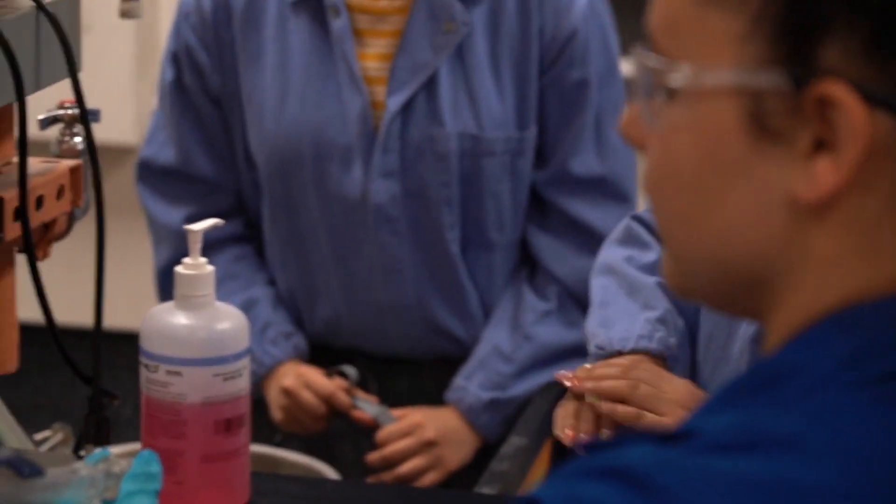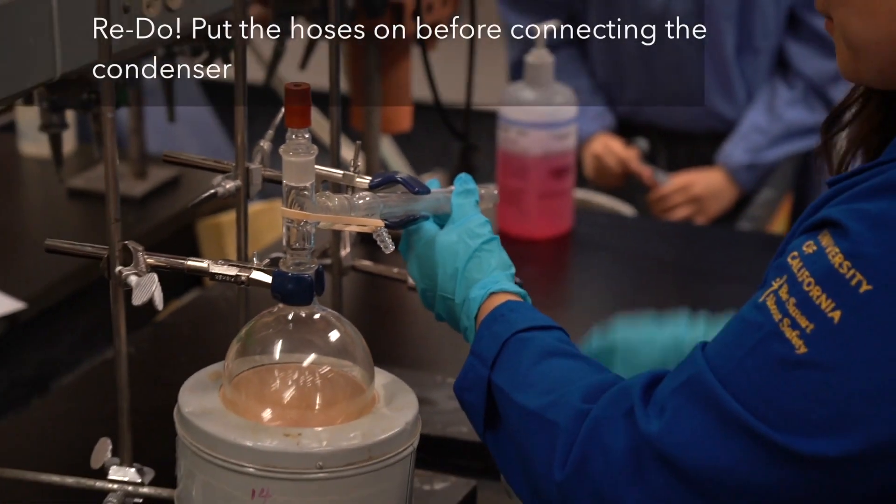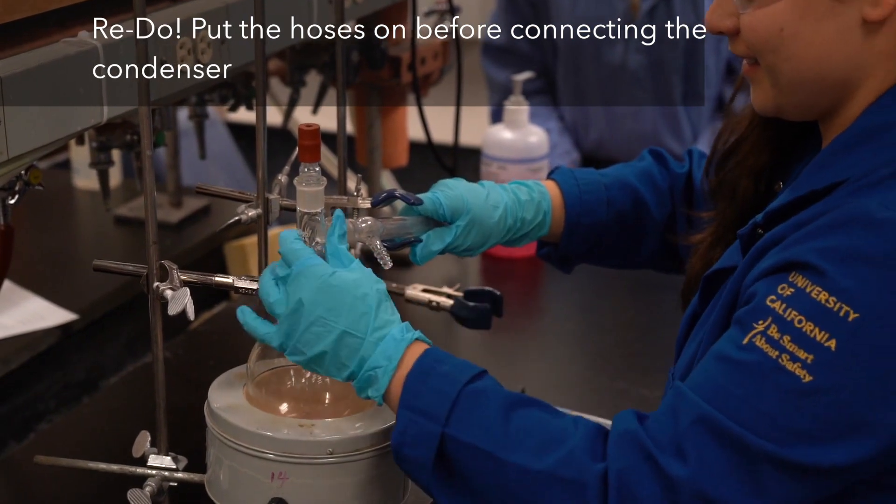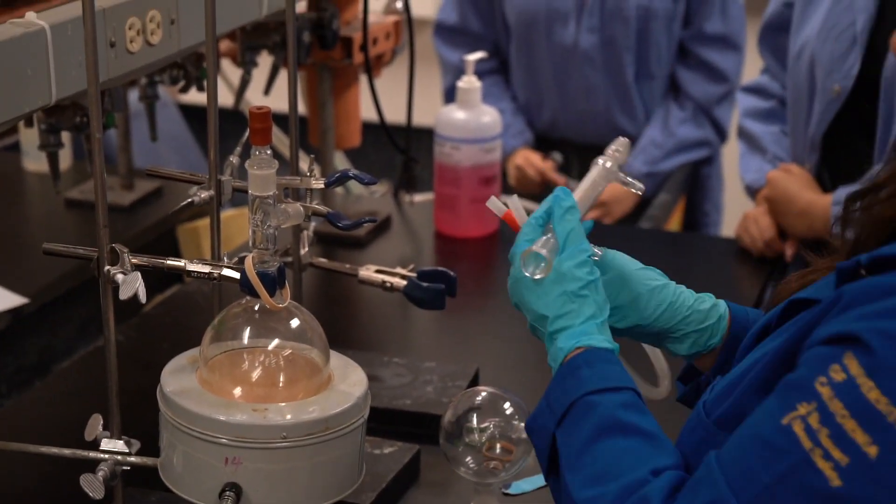Oh, you know what I didn't do? Water. So I'm going to disassemble. Almost everyone will have to assemble it twice because of stuff like that.